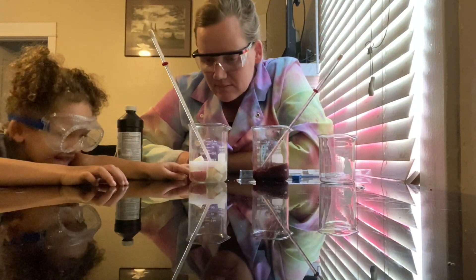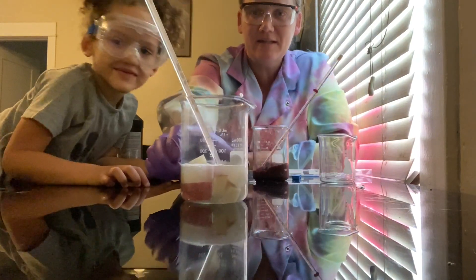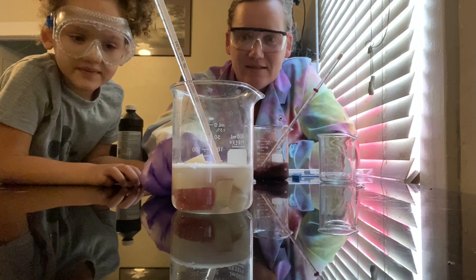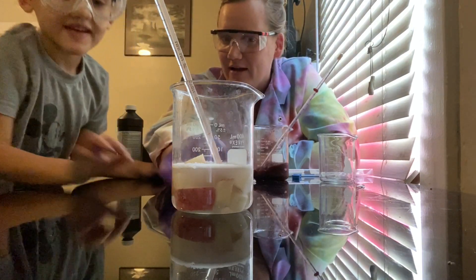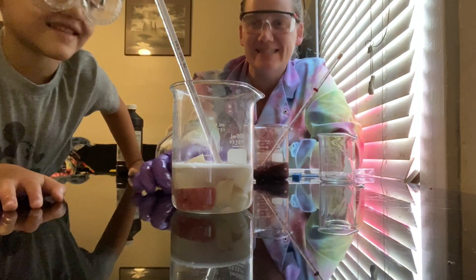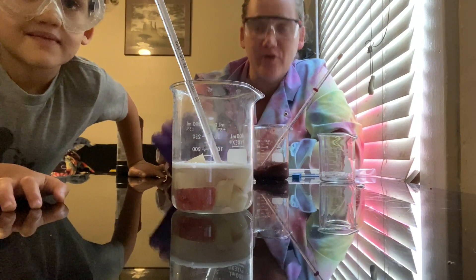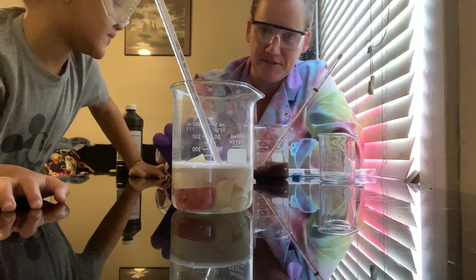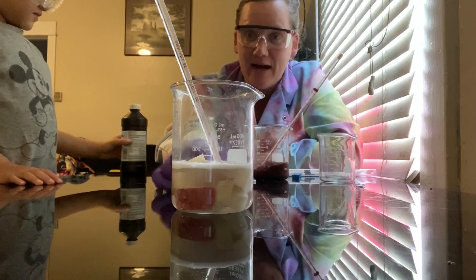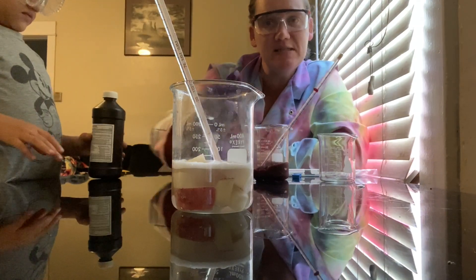It's turning into bubbles — it is foaming and producing bubbles. Those bubbles are part of the dissociation reaction, or the breakdown of hydrogen peroxide into oxygen gas and water. So the bubbles are actually oxygen gas. They look kind of like bubbles in soda, but soda has carbon dioxide bubbles, so this is a bit different.